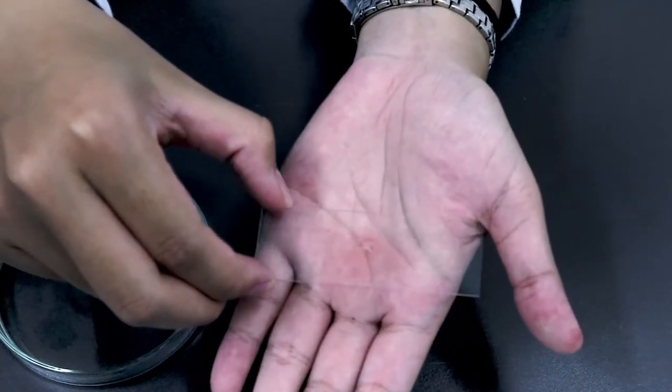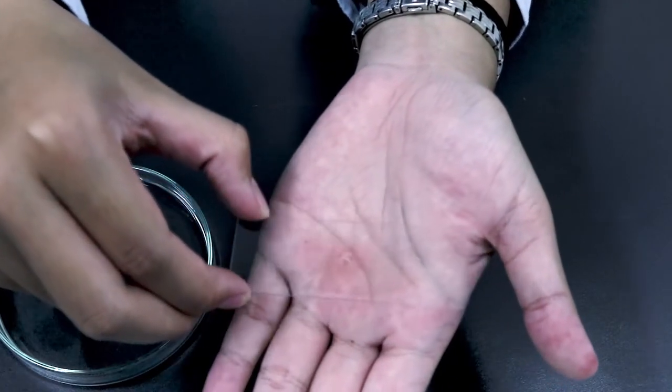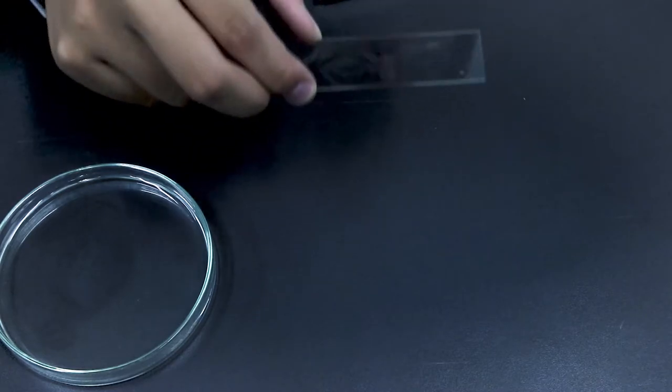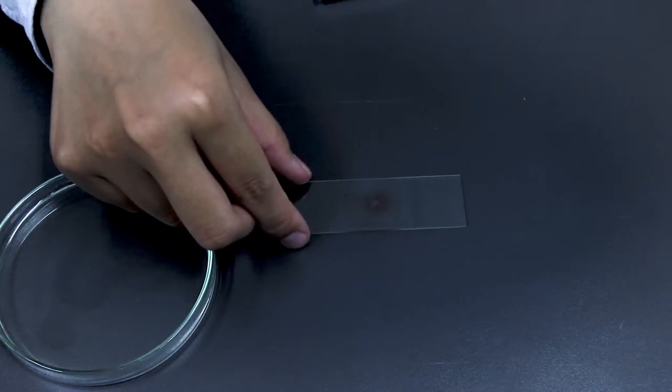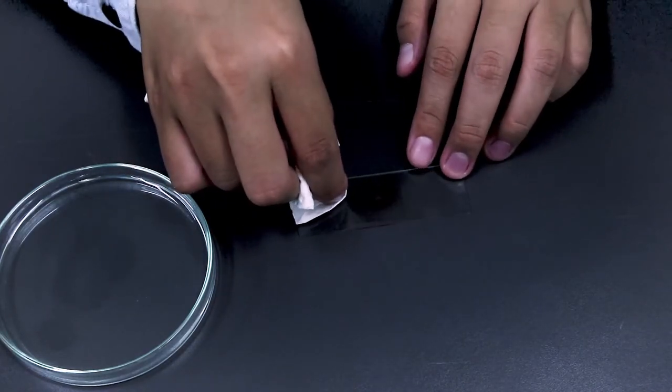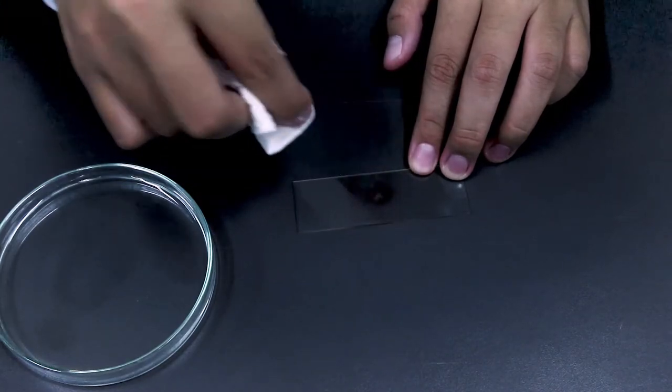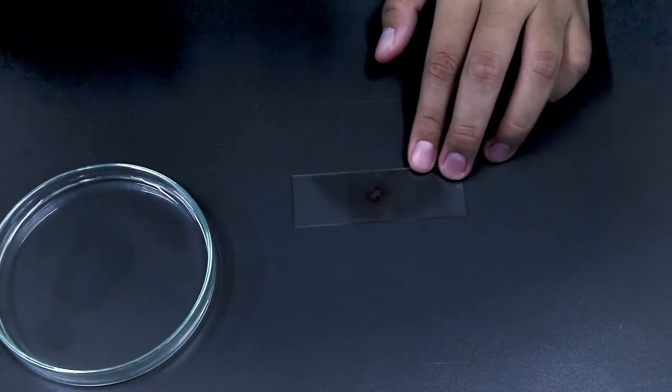So we got the chromosome that we want to have a look at here. Finally you have to get rid of the staining or the dye to make it clean. You just have to clean your slide before you can use it with the microscope.